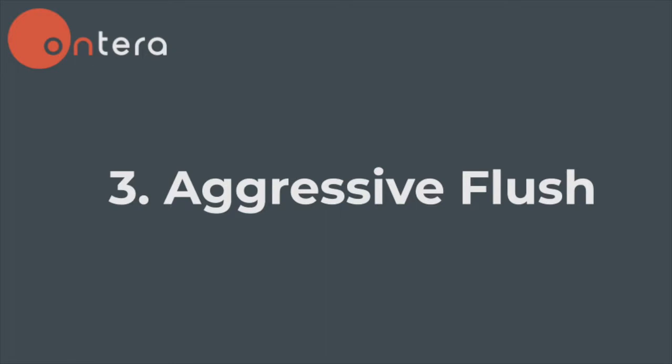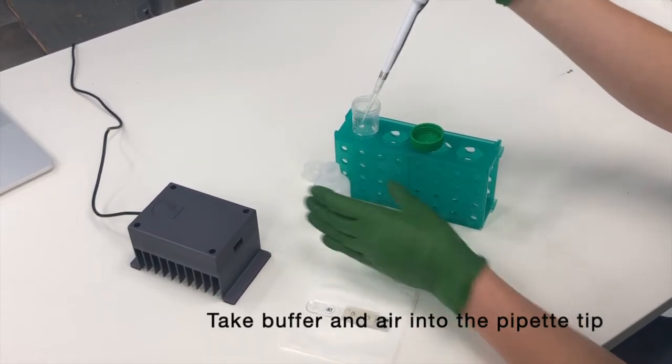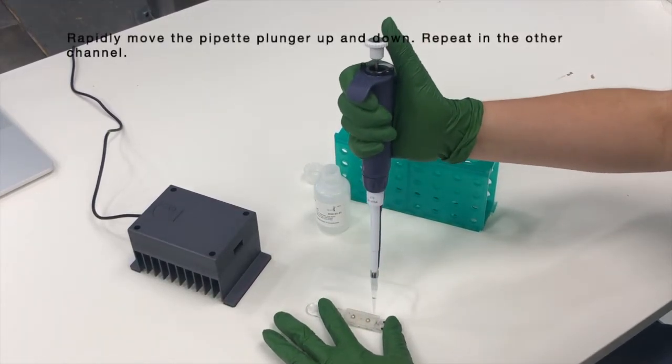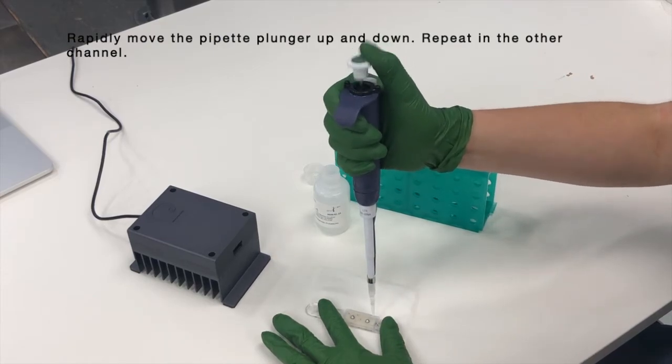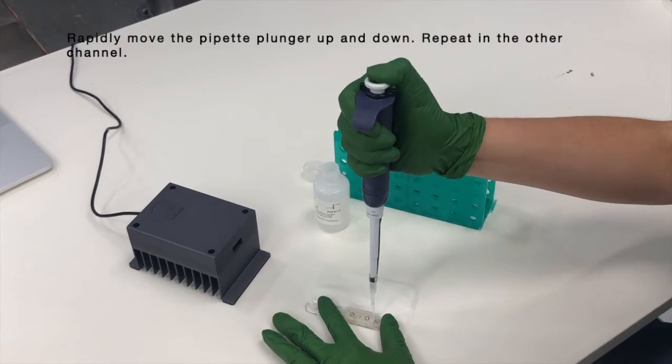If flushing did not work, move on to a technique that we like to call aggressive flushing. With aggressive flushing, you will rapidly and forcefully push buffer and air through the test strip channels. To do so, take some buffer and some air up into your pipette tip. Insert the tip into either channel and rapidly move the pipette plunger up and down. Continue for 10 to 15 seconds in each channel.